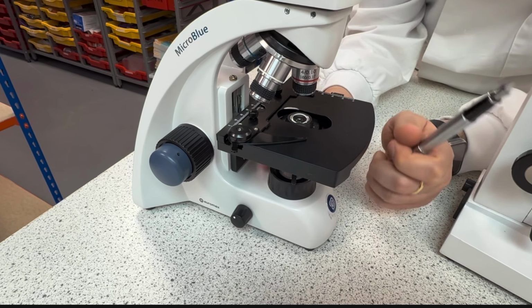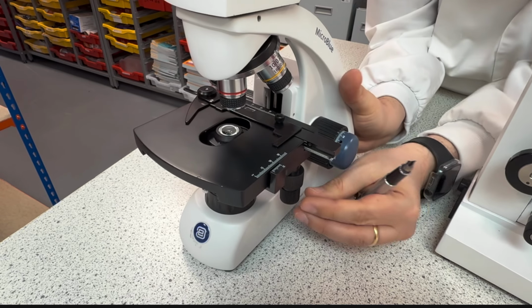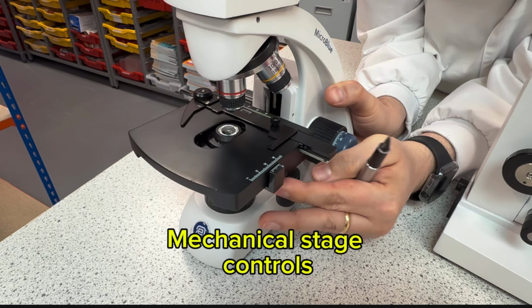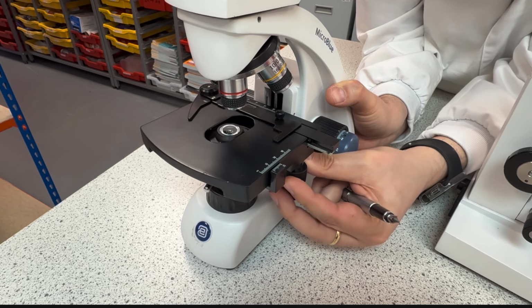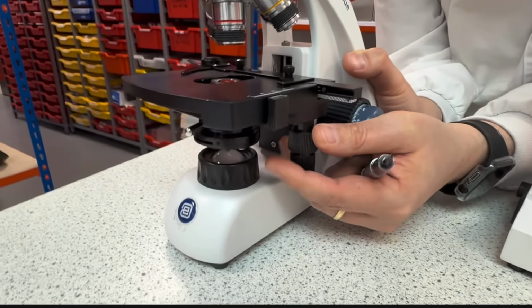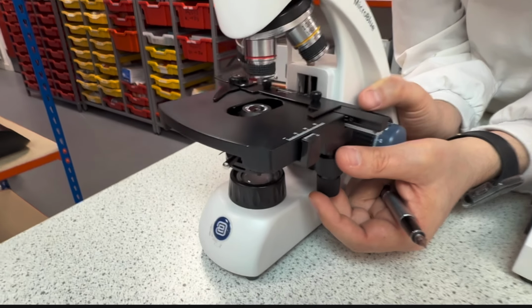With this microscope, I have on this side here adjustments to go forward, backwards, to the left, to the right. Okay, so I can work with these two to better see whatever I'm trying to see by the microscope.